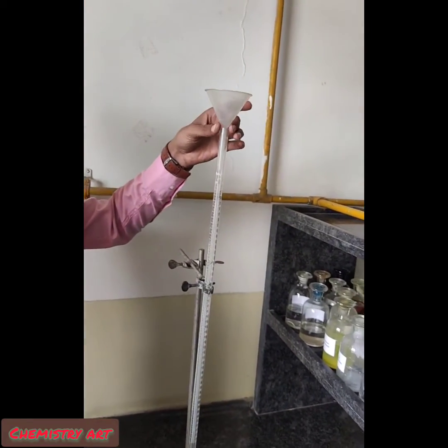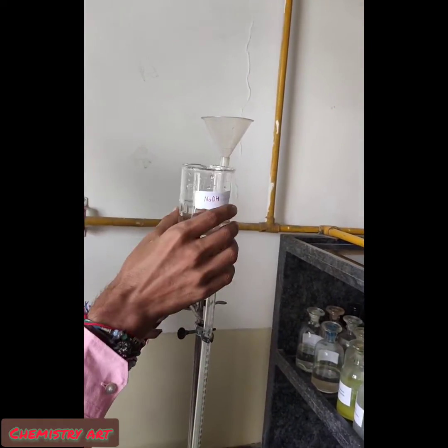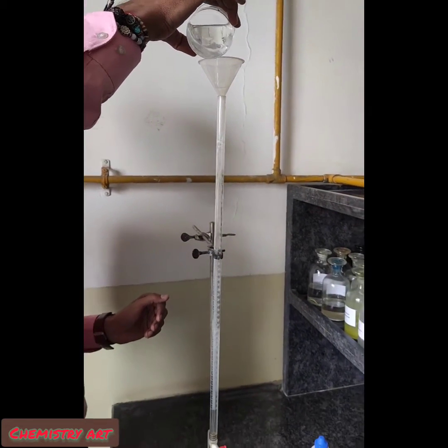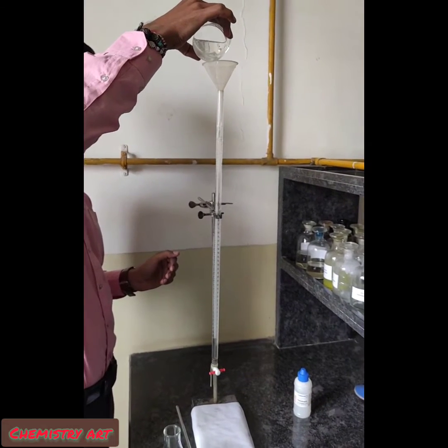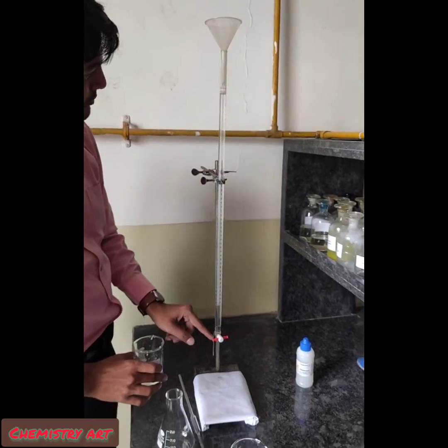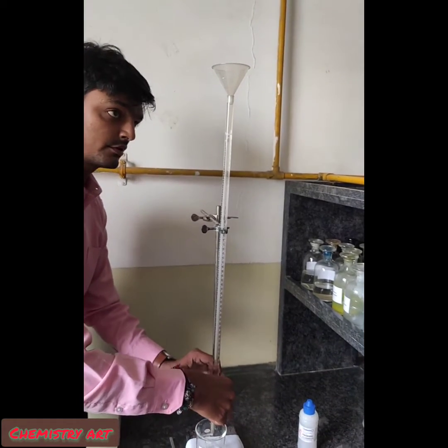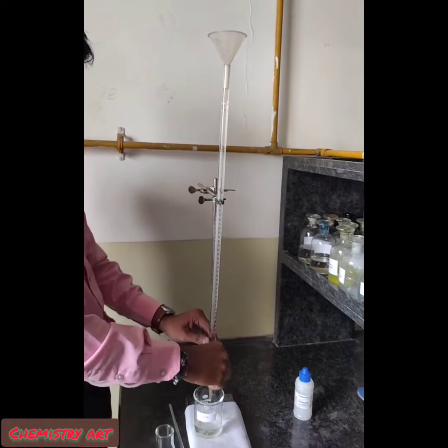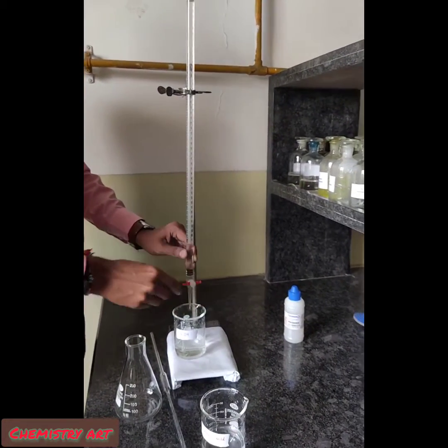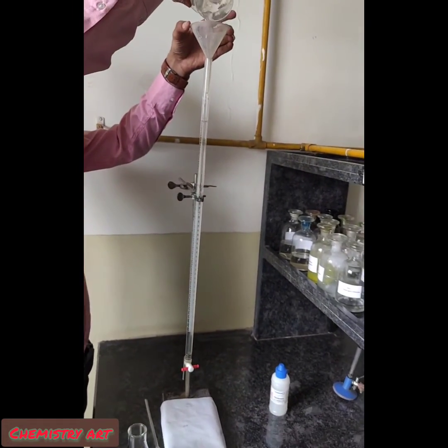First of all, we have to fill the burette with the unknown NaOH solution using a funnel. Add the NaOH and make sure the cork is closed. The lower part below the cork should also be filled. To fill it, open the cork so the extra solution comes out from that side. No air bubbles should be present — you can see here there are no air bubbles.